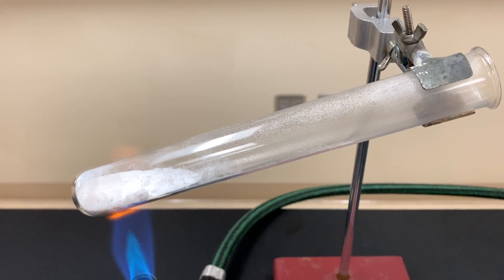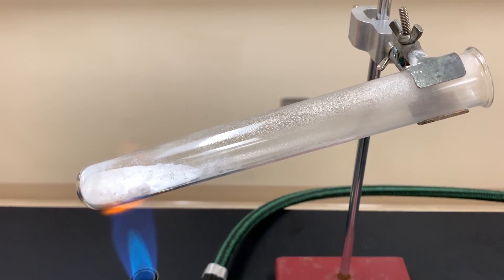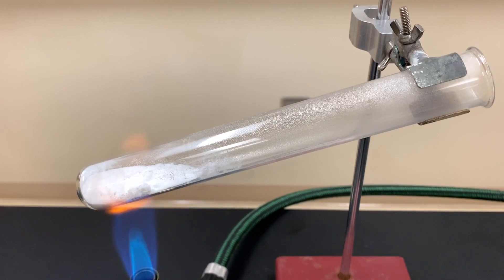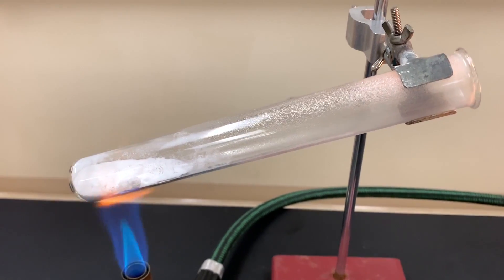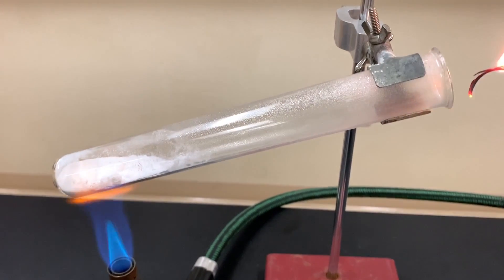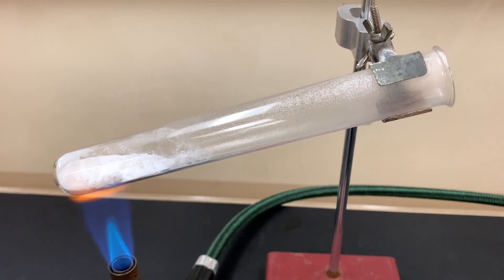The next thing we're going to do is do some carbon dioxide tests and see if that's present. So I'm going to do the first one which is where I light the wood splint and I place it into or near the mouth of the test tube and see if there's any evidence of carbon dioxide.